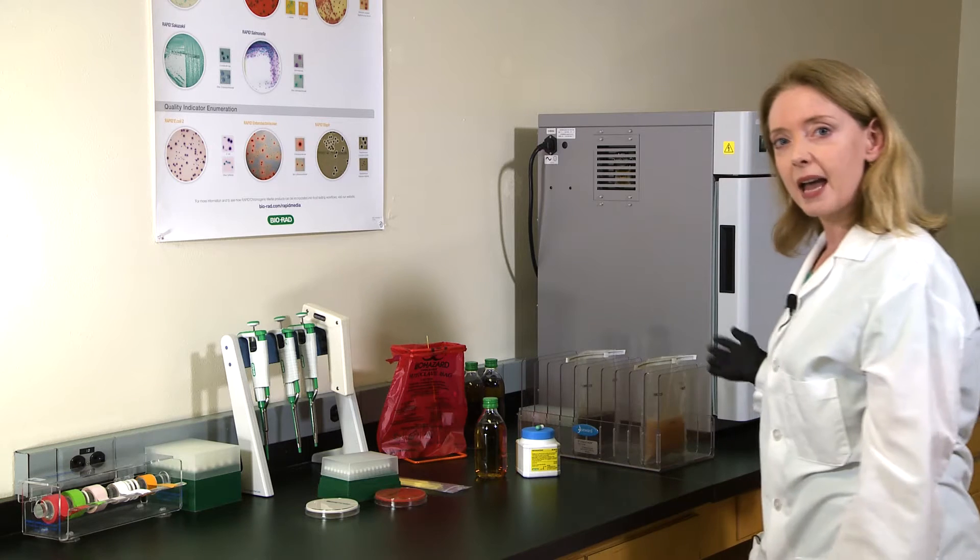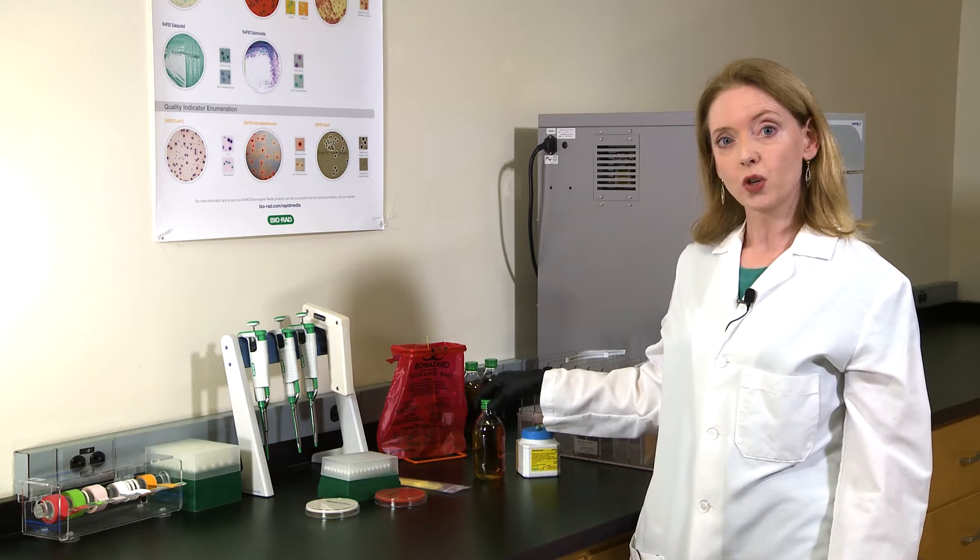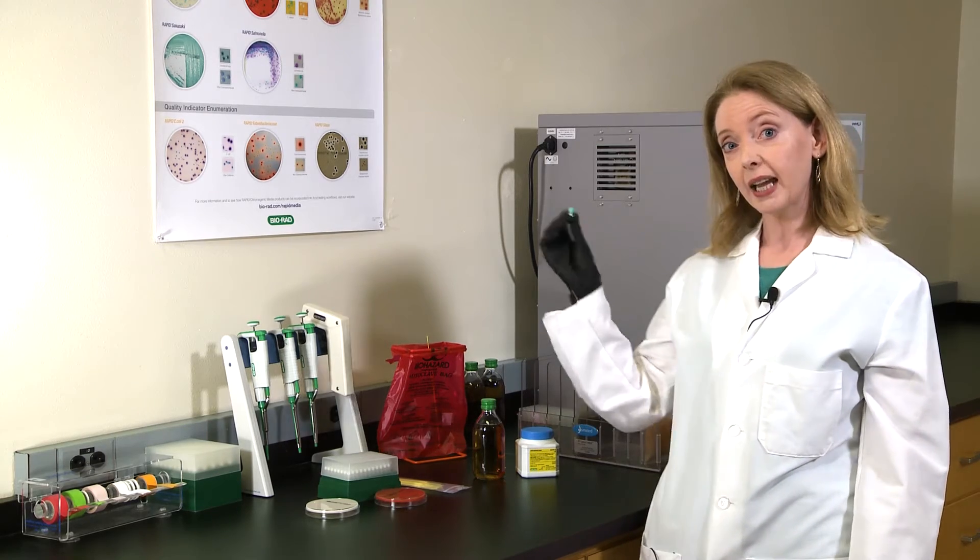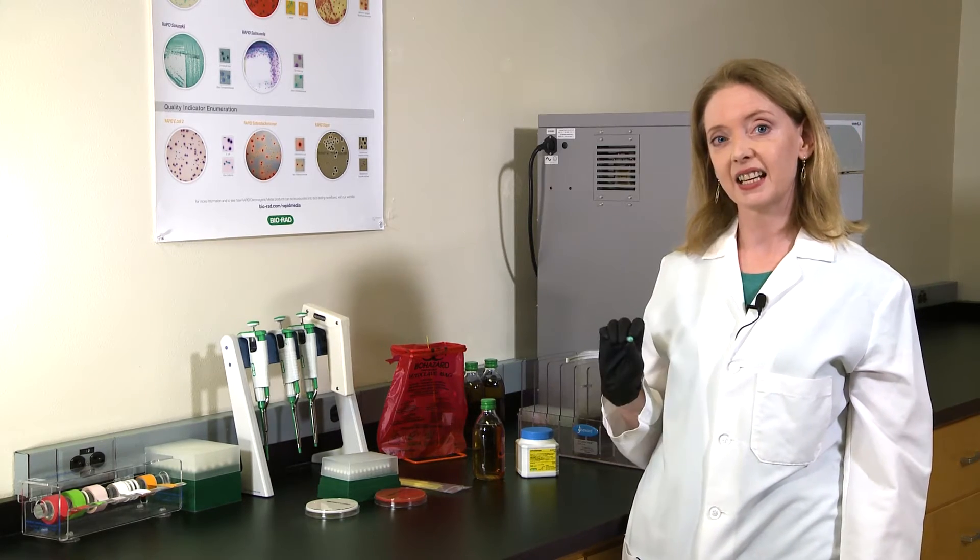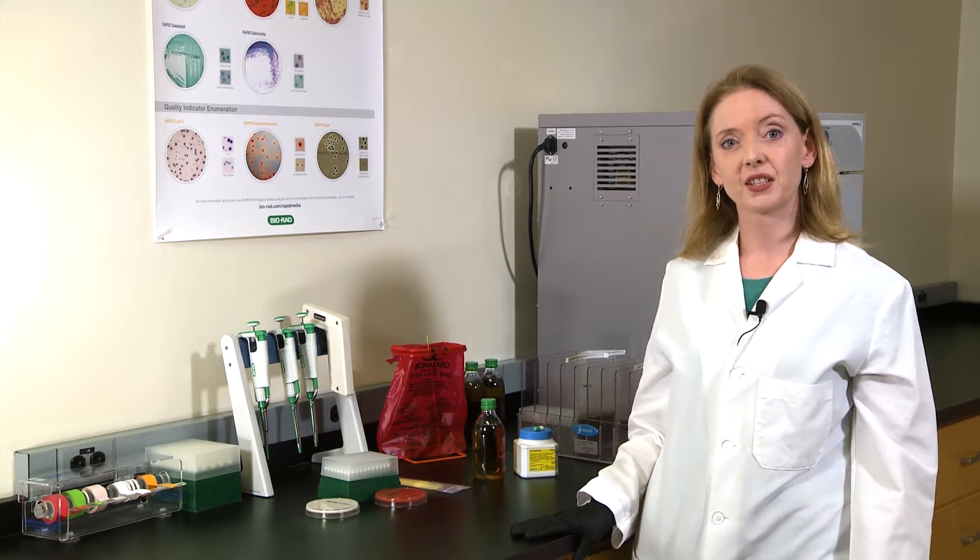I've already prepared my food sample in the stomacher bag using the rapid salmonella short protocol. The enrichment was performed using a 1 to 10 dilution of the buffered peptone water supplemented with one capsule containing specific selective agents. I've incubated my enrichment sample for 18 hours at 41.5 degrees Celsius.